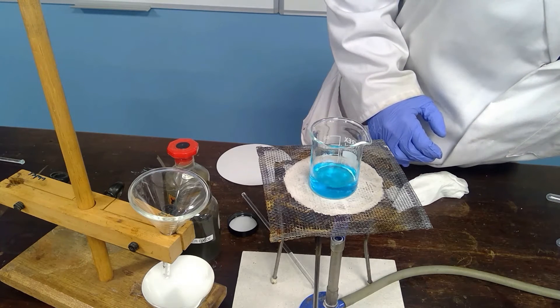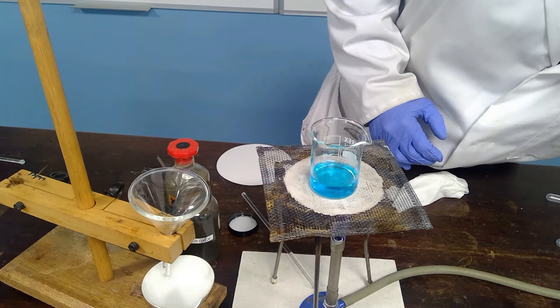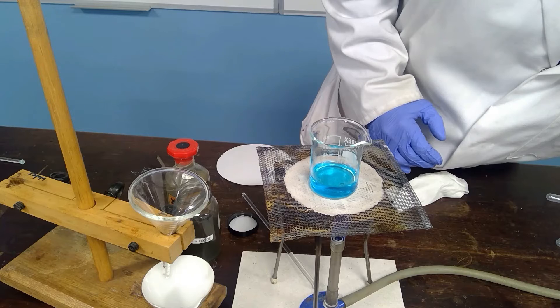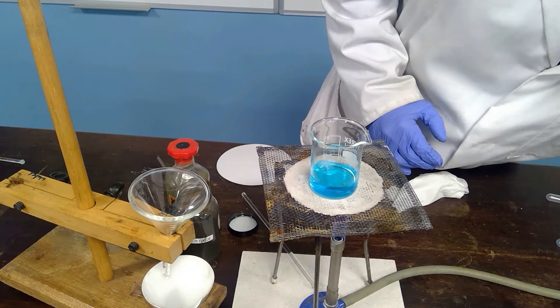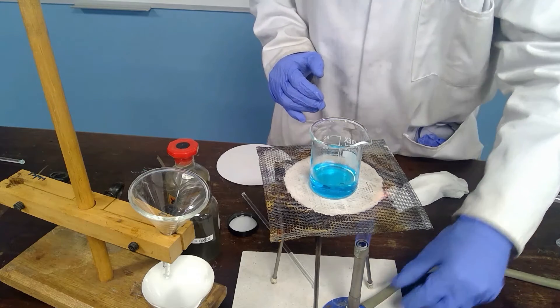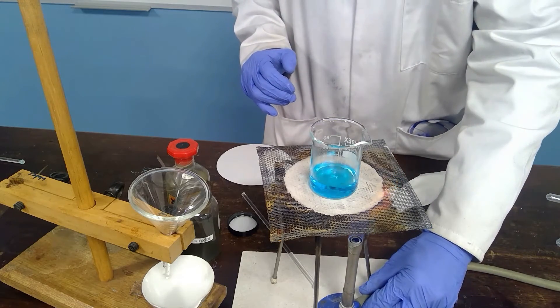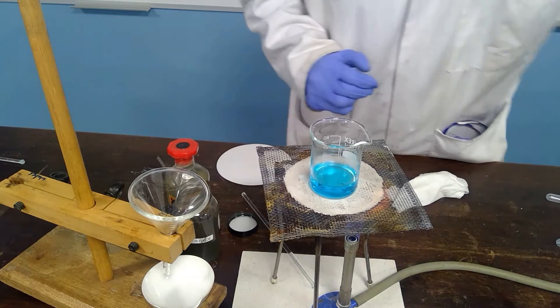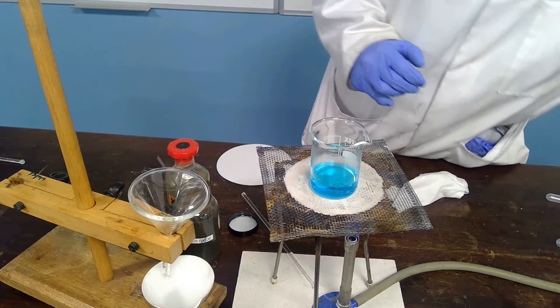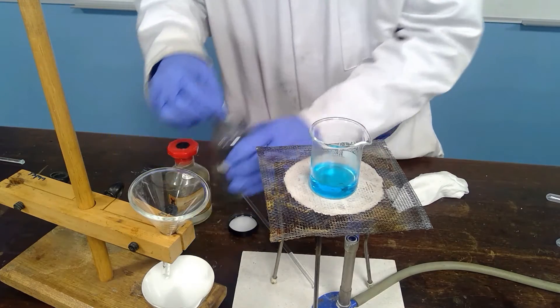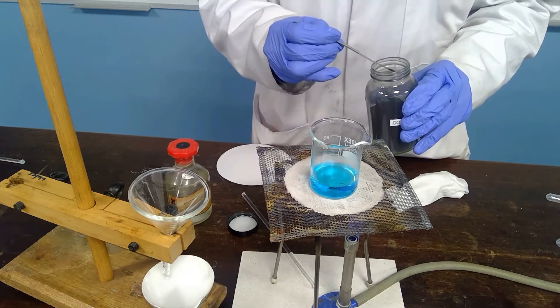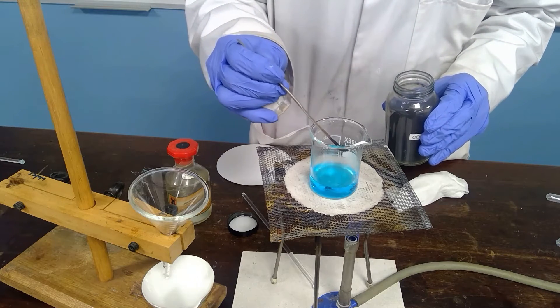As we add the copper oxide to the hot acid you will see that it will react.